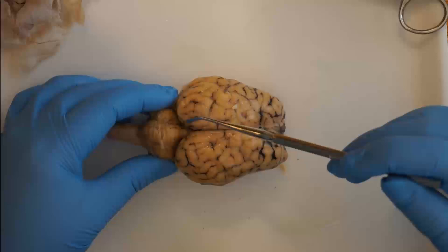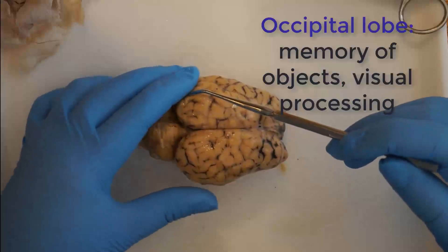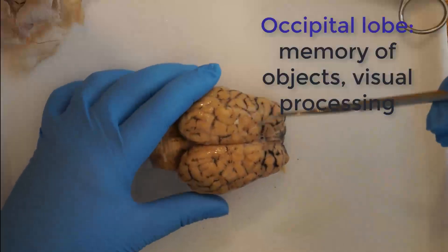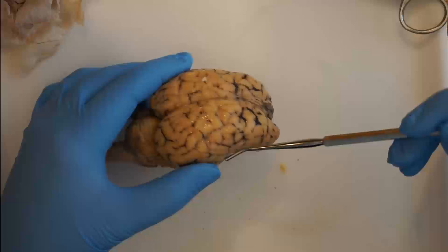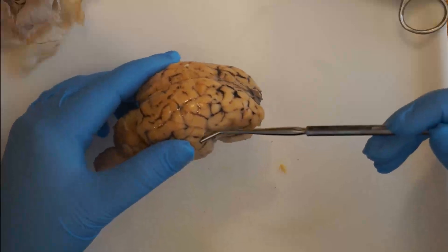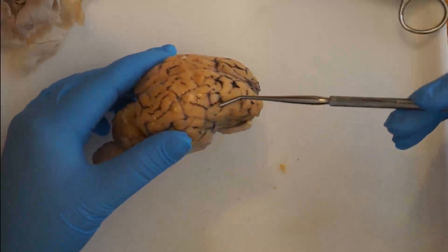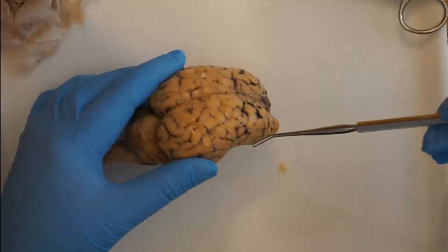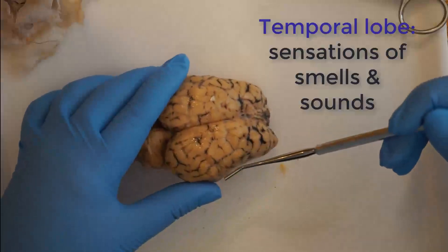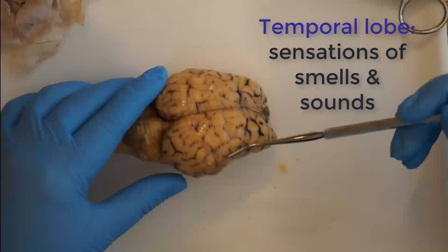The occipital lobe is responsible for memory of objects and visual processing, and the temporal lobes are on the sides. Those aid in memory, comprehension, and sensation of smells and sounds.